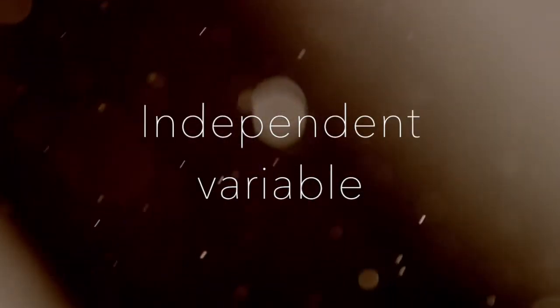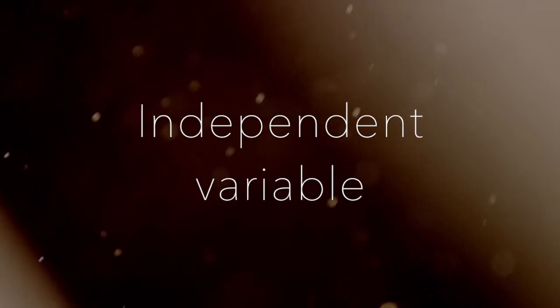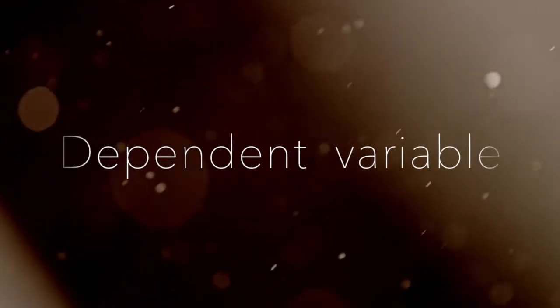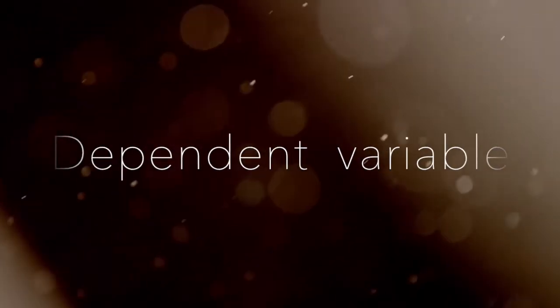Our independent variable for the first investigation is temperature. For the second investigation, it is the concentration of dissolved sodium chloride. Our dependent variable is the number of staples staying afloat.